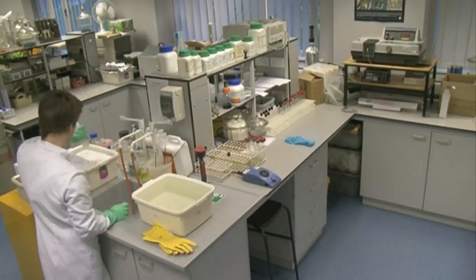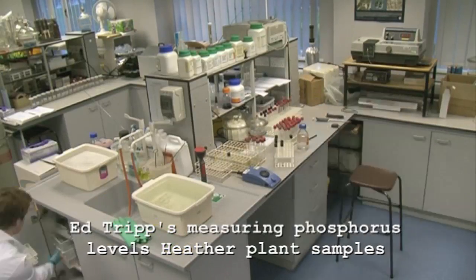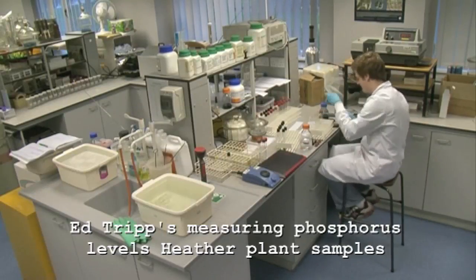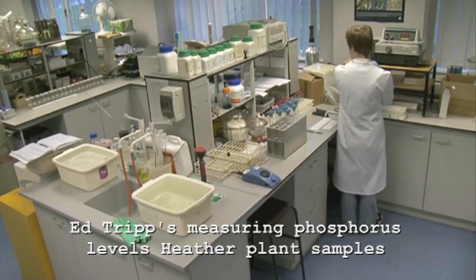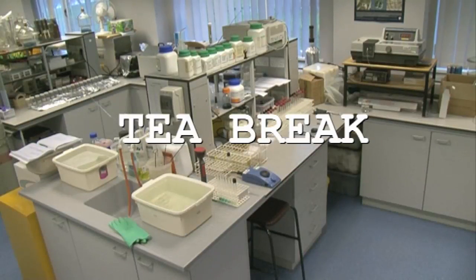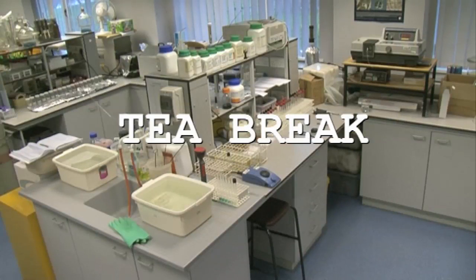What I need to do is see what was in the soils and see how that might be affecting the heather plants. So it involves a lot of chemistry and a lot of chemicals. I'm going to have notebooks full of numbers. When I was going around the country I collected — well, I went to 26 sites, so I collected 500 plants — so I'll have to do this quite a number of times.